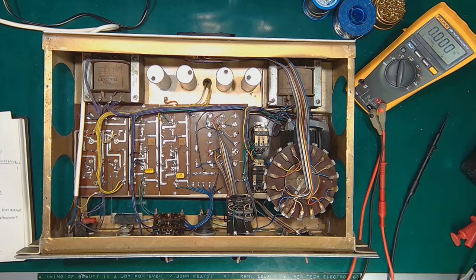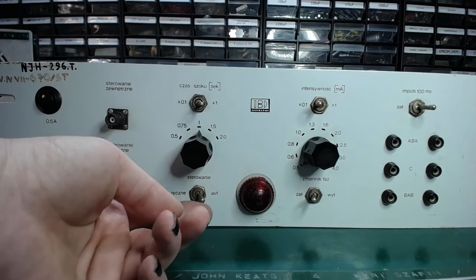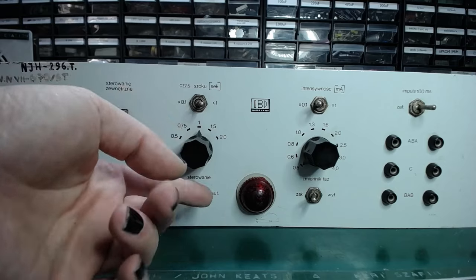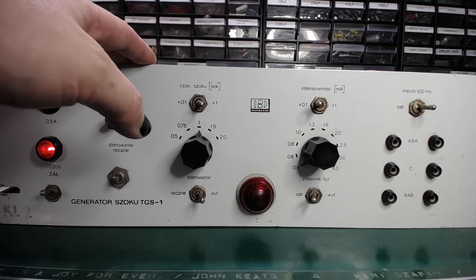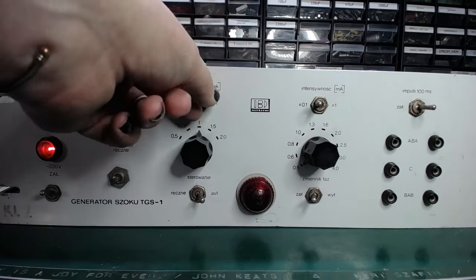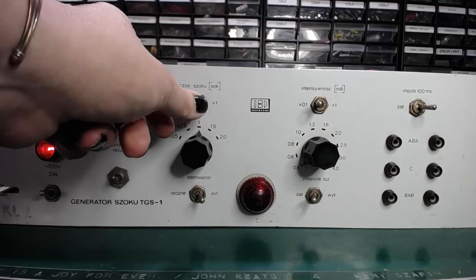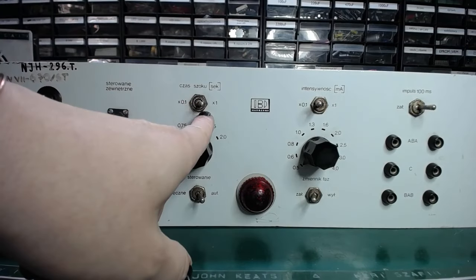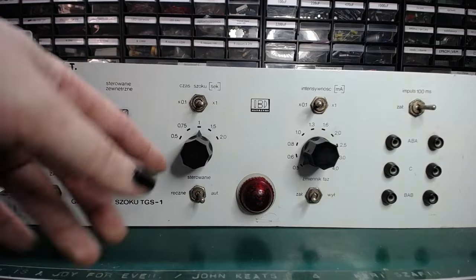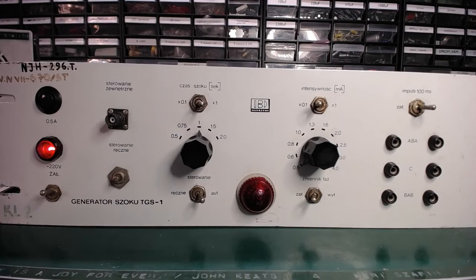But now, let's see what it does. This switch changes the operation mode from manual to automatic. In automatic mode, the unit uses a timer for setting the shock duration. And the timer is controlled by two switches that set the time constant of an RC time circuit. Times 0.1 and times 1. Because the shock durations at 0.1 would be in the range of milliseconds.